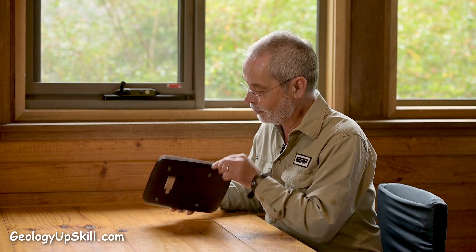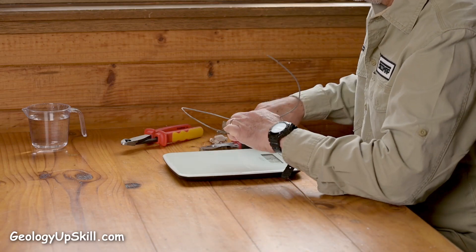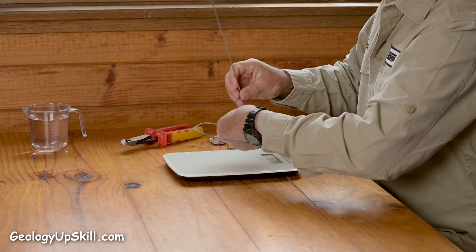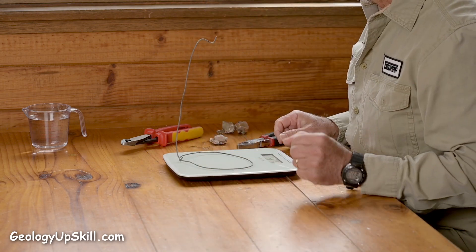Now figuring out the volume of this is going to be a little bit more tricky. You normally do that by suspending it from a thread beneath the balance and measuring the weight in water to see how much water it displaces. It's going to be a little bit tricky with this one because it doesn't have a hook underneath, but I've got an idea. I'm just going to make a simple wire frame and suspend the crystal with a thin piece of fishing line so that I can record the displacement above the weighing scale.